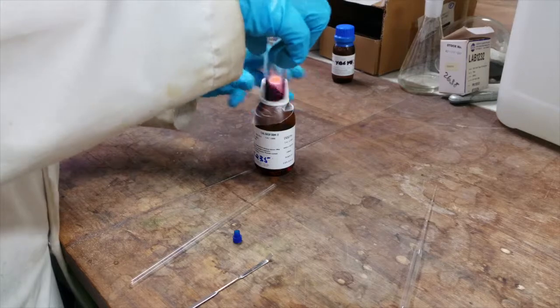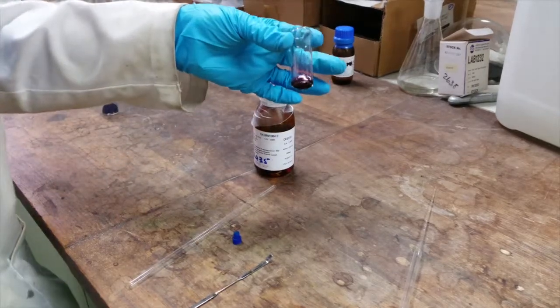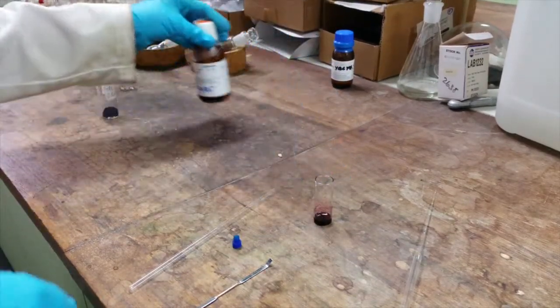Ensure that your sample is completely dissolved in the solvent. An appropriately concentrated solution should be an intense red colour at this point.